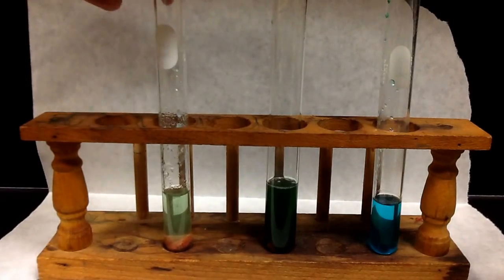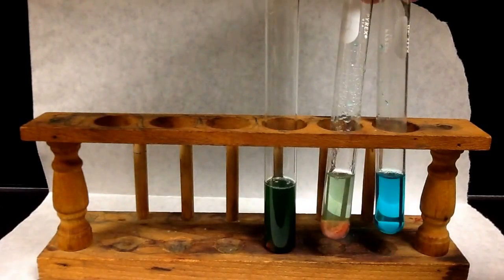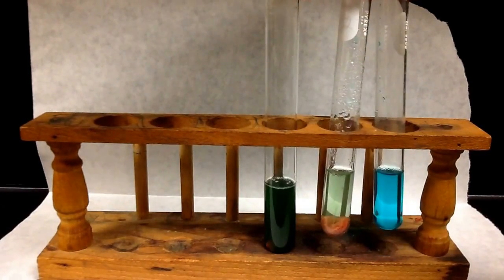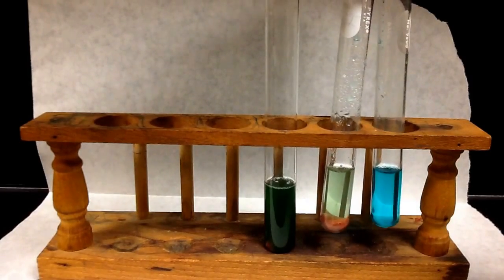It's a lot lighter green. So if I hold this next to, and hold these up kind of a before and after, you can see that it's a much paler green. And you might be able to tell what color solid we have in there.